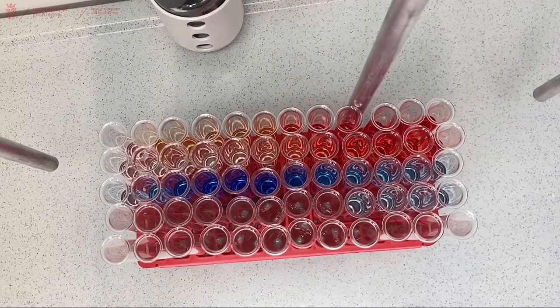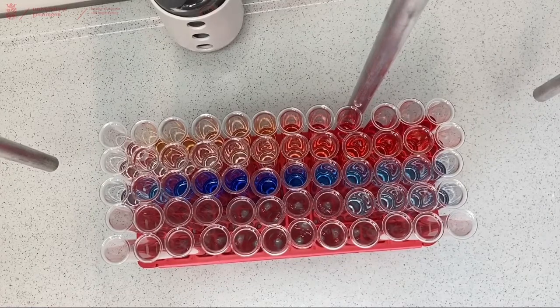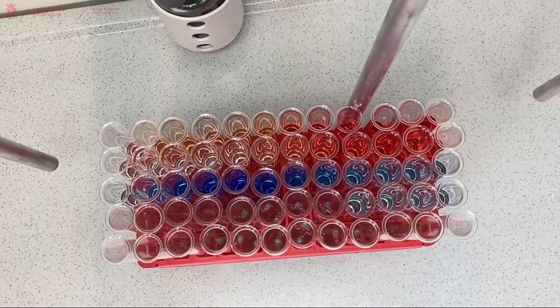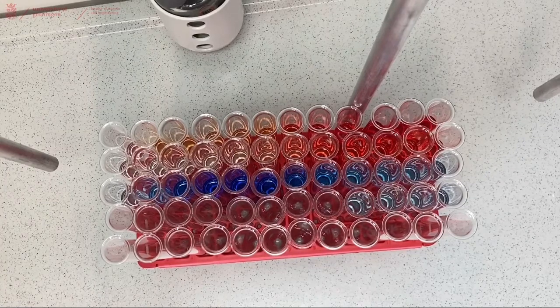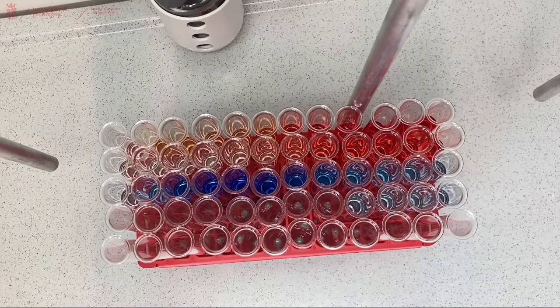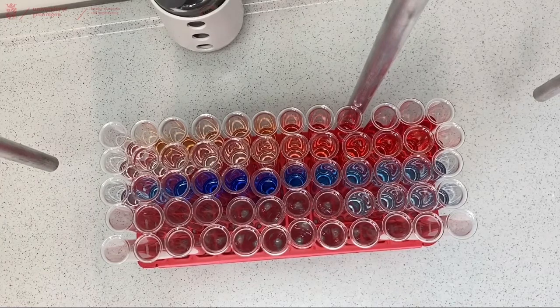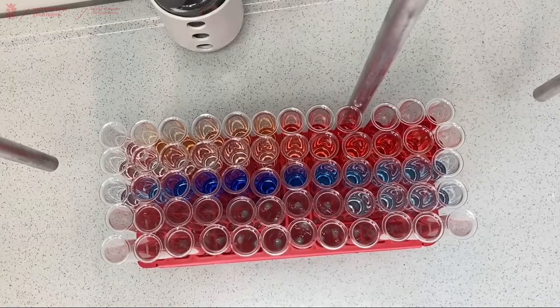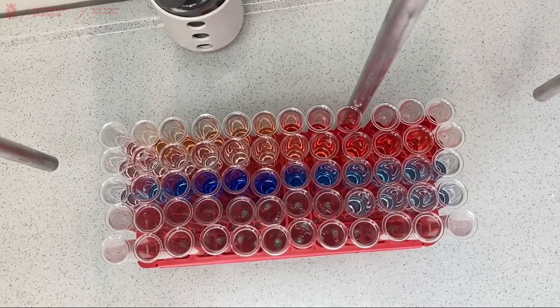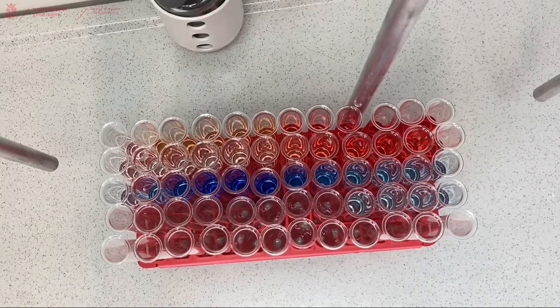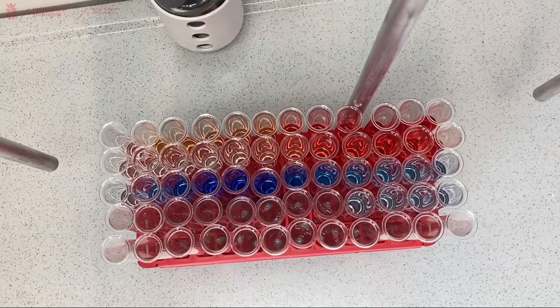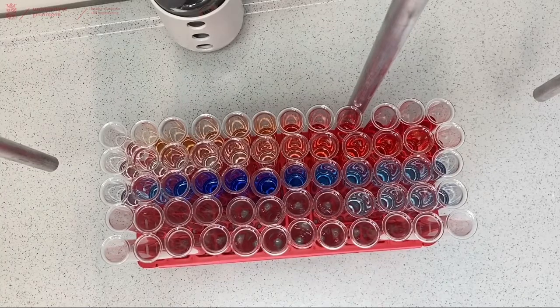Now we just have to identify from these fractions which contain pure compound, and you can do this by running TLCs of every fraction or every other fraction to see which fraction is pure. And then when you identify all your pure fractions you combine them into a big flask, use the rotary evaporator to remove the solvent and identify what you isolated by using any of the analytical techniques.